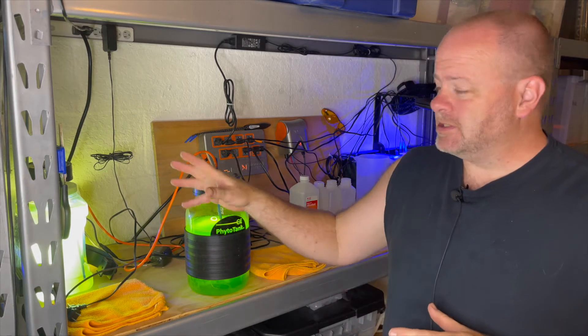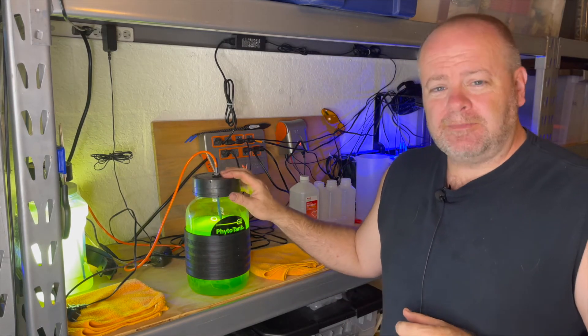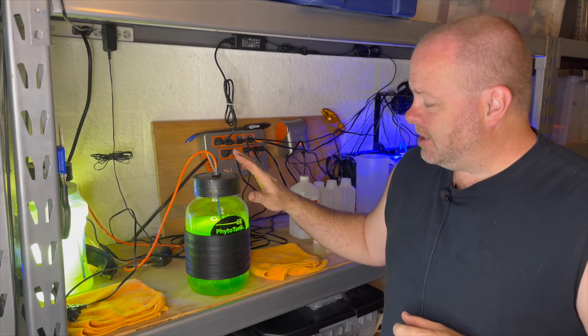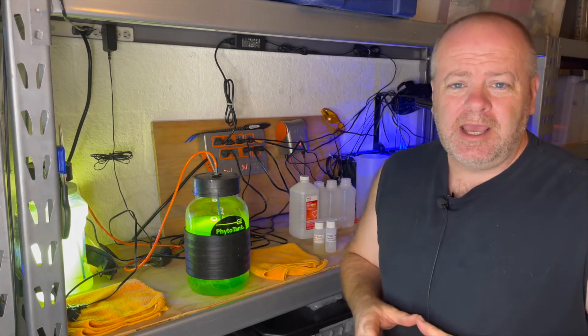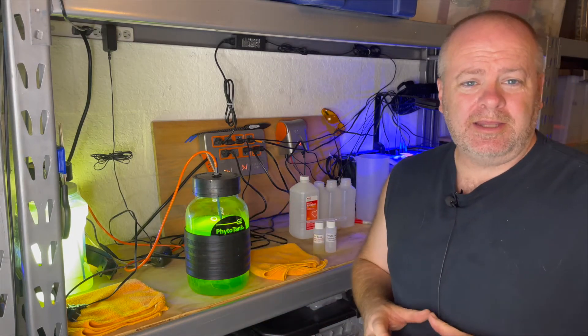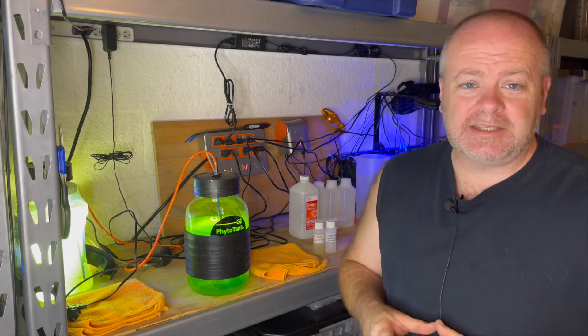And today I'm going to show you, I've already harvested two. This is the batch that I'm getting ready to harvest. It's pretty simple and I'm going to show you what I do to harvest it and get it ready. And then I'm going to show you how I get the bottle ready for the next culture.